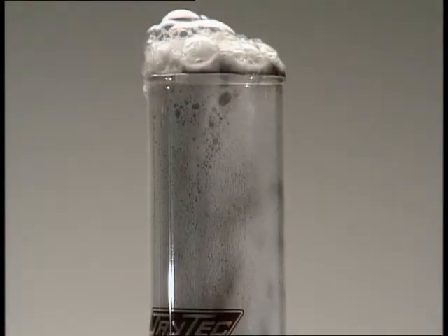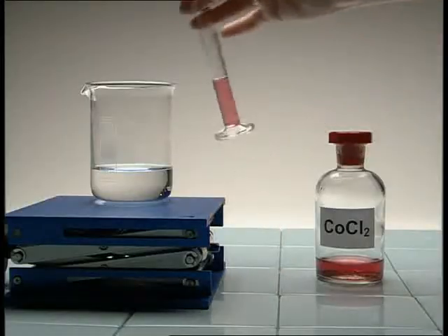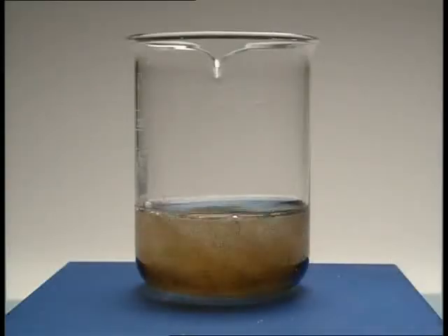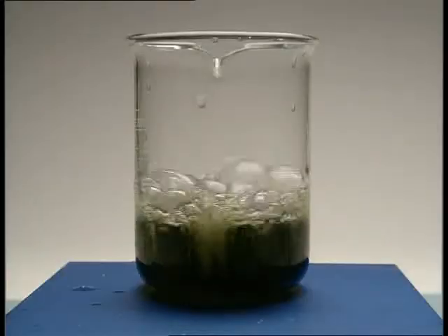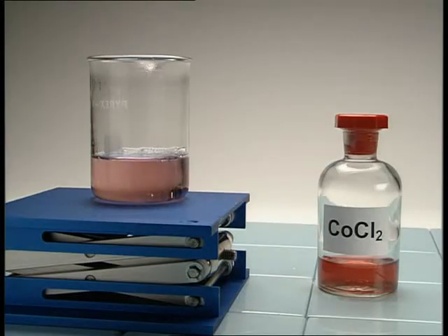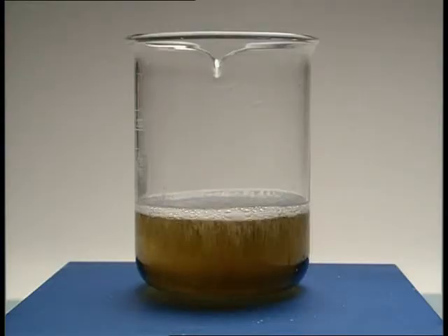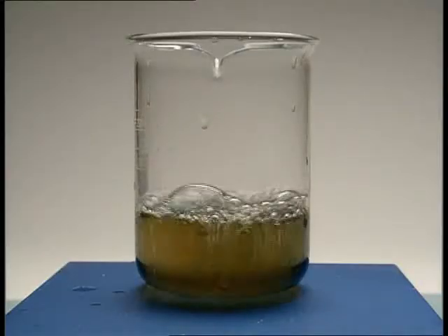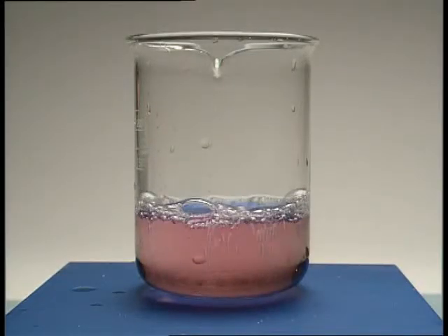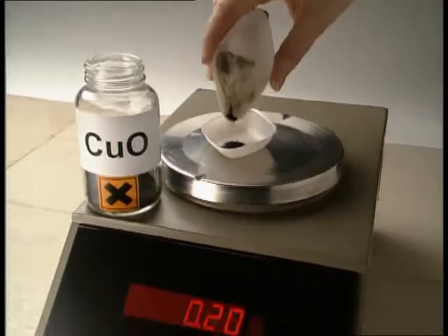Specific catalysts are used to speed up specific reactions. Cobalt chloride solution is the catalyst in this next reaction. A catalyst is a chemical that takes part in a reaction but doesn't get used up. At the end of the reaction, the pink cobalt chloride has returned to its original state. So the amount of any catalyst added to a reaction should still be present at the end.